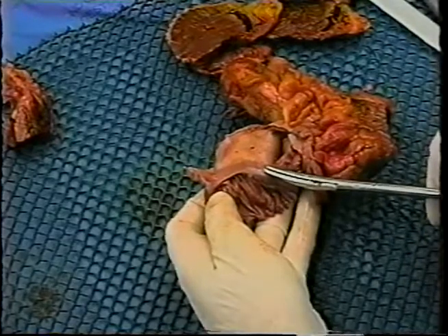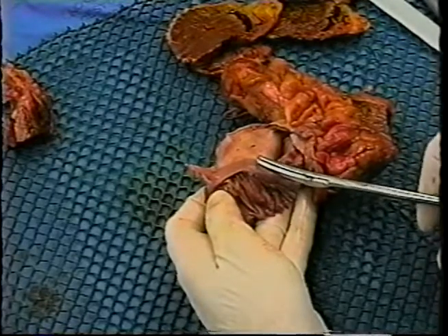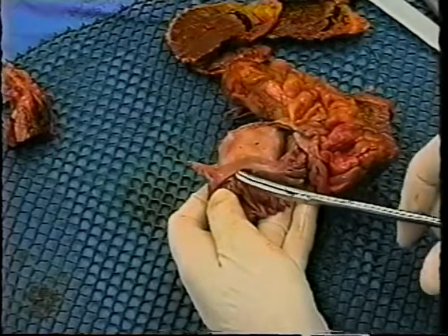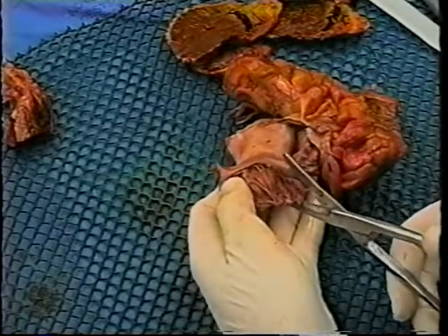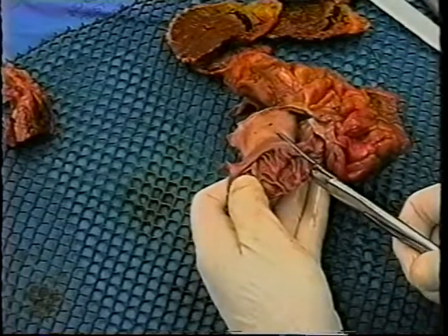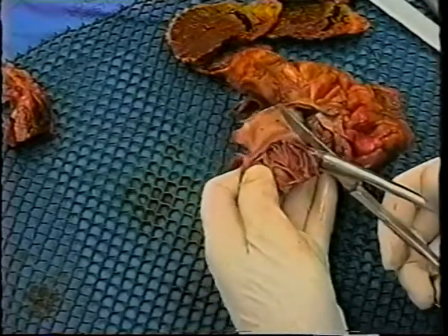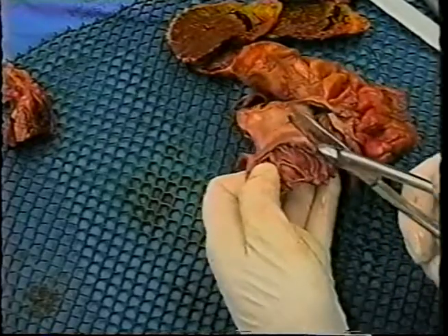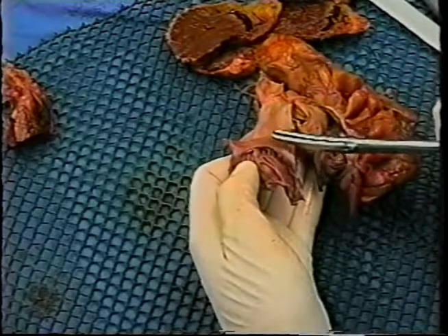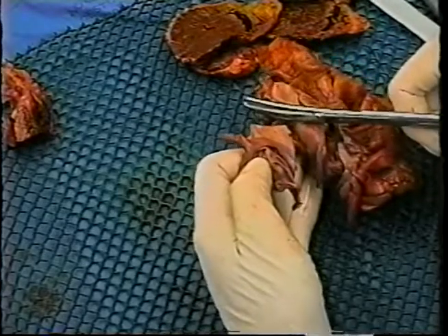This is the crista terminalis. This is the landmark that we want to preserve because the SA node is located in the sulcus terminalis, located on the epicardial side of the crista. Our second cut is made perpendicular to the crista terminalis on up to the superior vena cava, and we will end up with an approximately rectangular piece of tissue. As long as we go at least a centimeter above the crista terminalis, we will be in good shape for having sinoatrial nodal tissue.